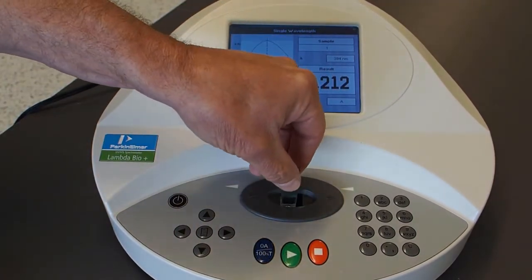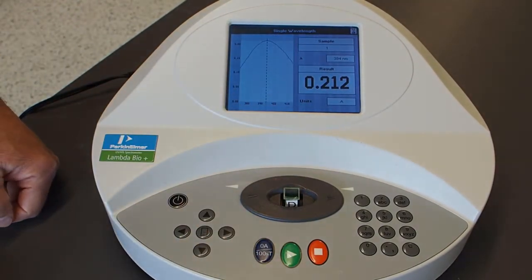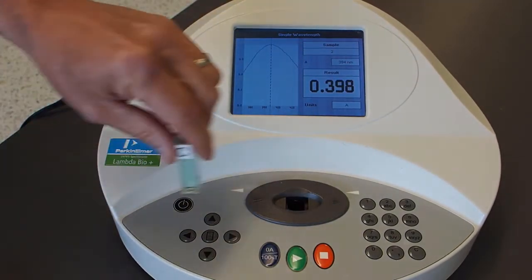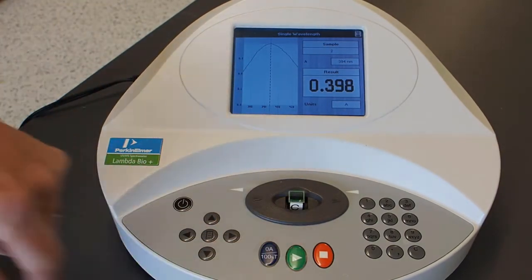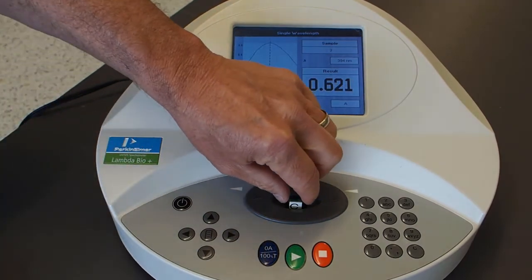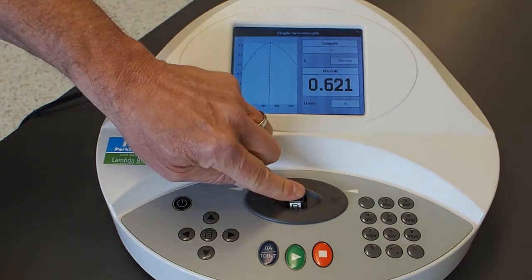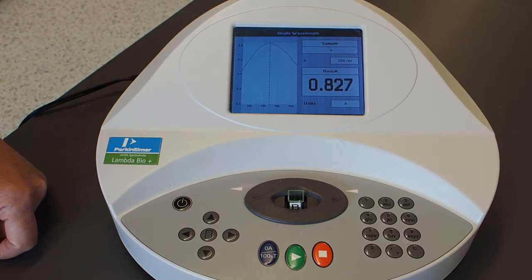Next we do sample D. We're writing these down as we go. Sample D is 0.398. Then sample C — these are getting progressively more concentrated, so the absorbance is going up. Sample C is 0.621.